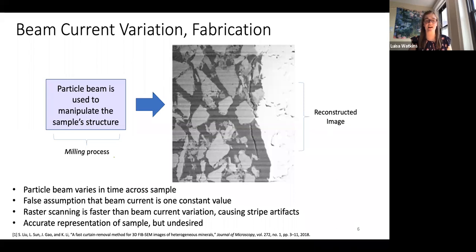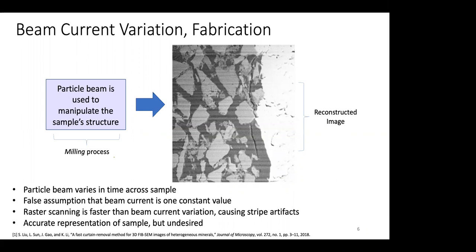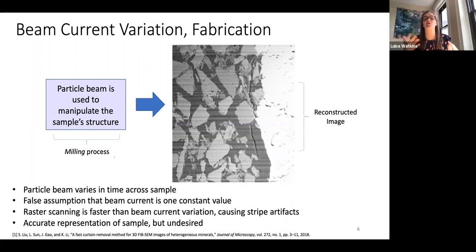So although the results are the same, where you see the stripes, this is actually in response to the milling, where it actually does look like that, versus in the image reconstruction, where it's just from the way that it's being reconstructed and assuming that the dose is constant. So these are the effects of beam current variation.